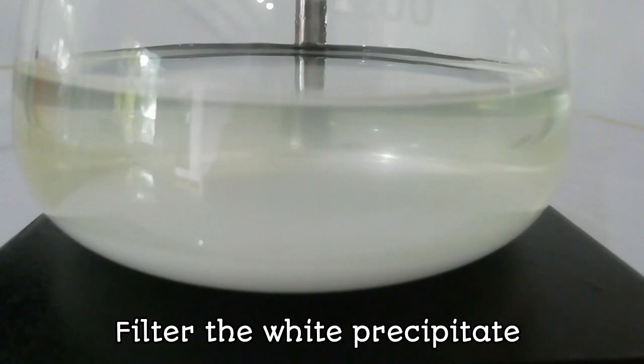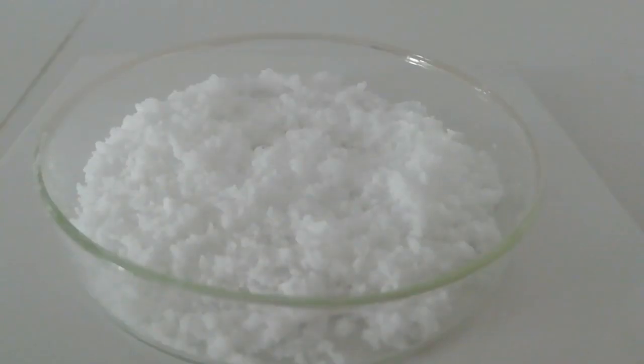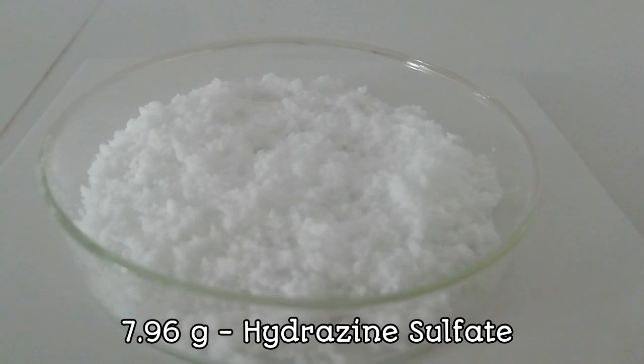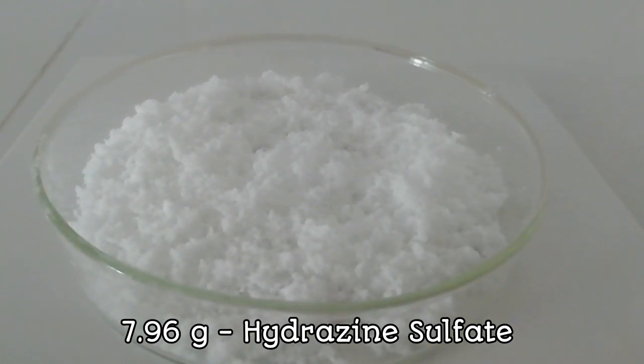After filtering the hydrazine sulfate, here is the final product: 7.96 grams of pure hydrazine sulfate.